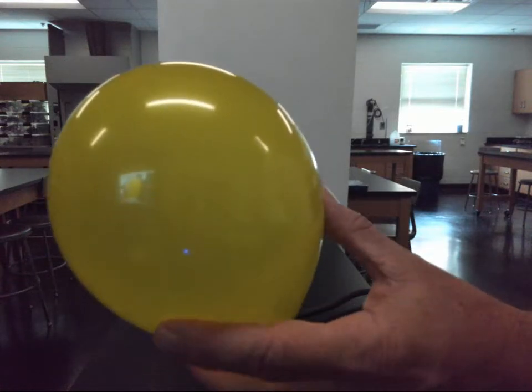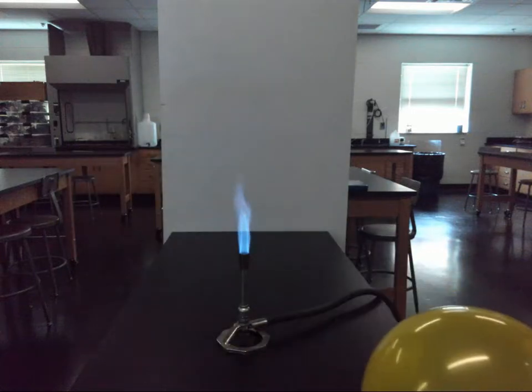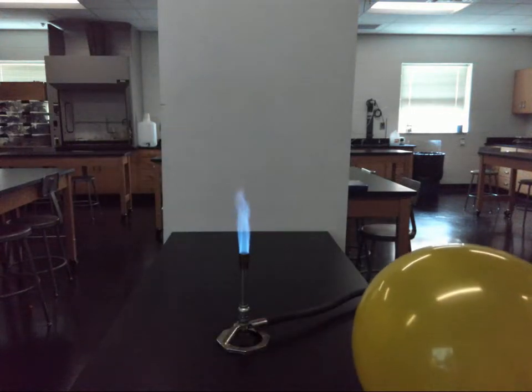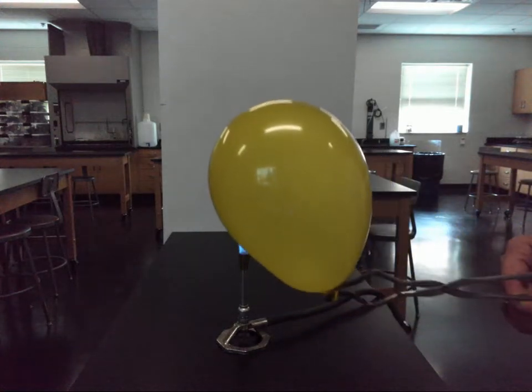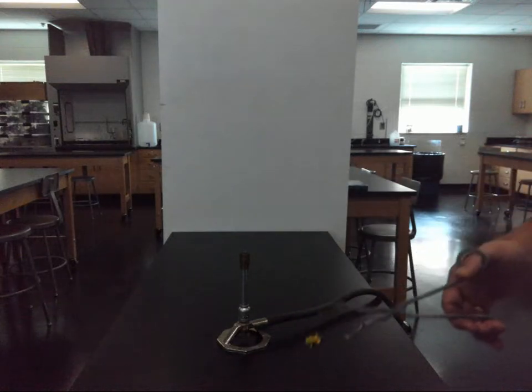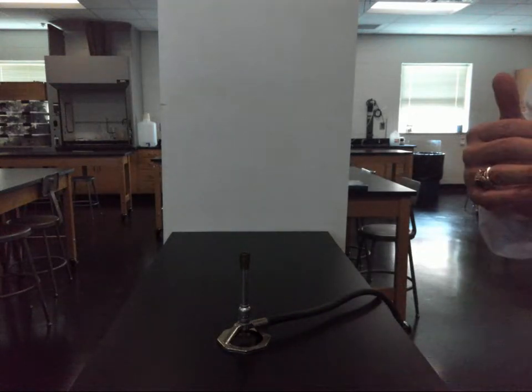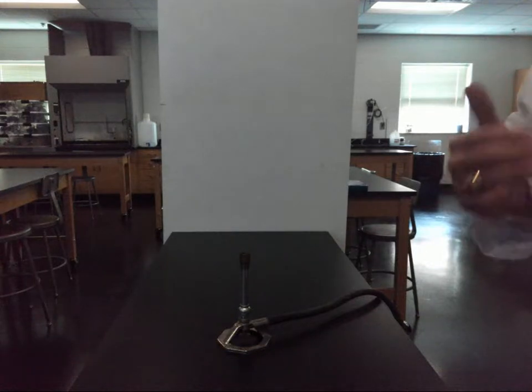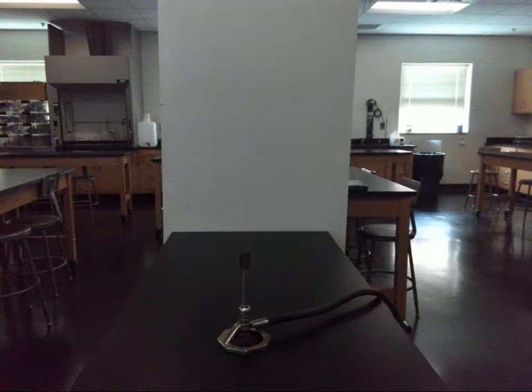Now that I have a nice little hydrogen balloon here, I'm going to show that this is an explosive gas by putting it into this Bunsen burner flame. So as you can see, hydrogen does have explosive properties as you are able to just witness. Students love this reaction.